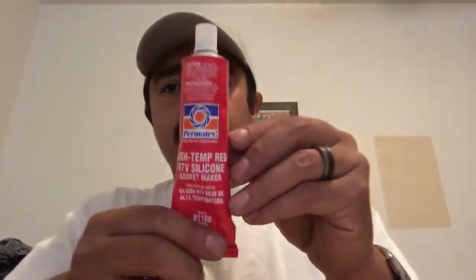I usually do about three at a time. I found that anything more than three makes the holes not drill quite as evenly. I'm going to be putting two holes into them — one is going to be for the high temperature RTV silicone, which you can get at any hardware store, Walmart, Kmart, anywhere like that. For the inoculation point I like to make that close to center, using a quarter inch drill bit. For the next hole, which is for an air port, I use a 13/64 inch drill bit.